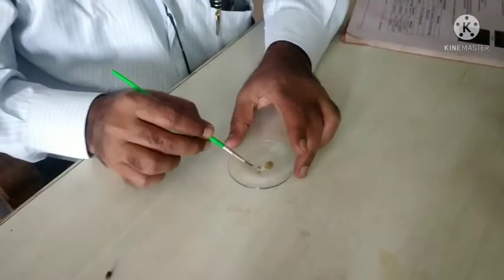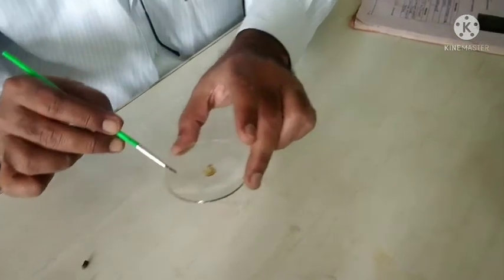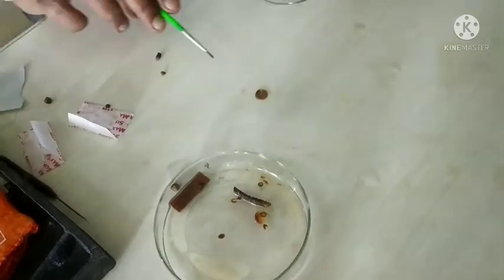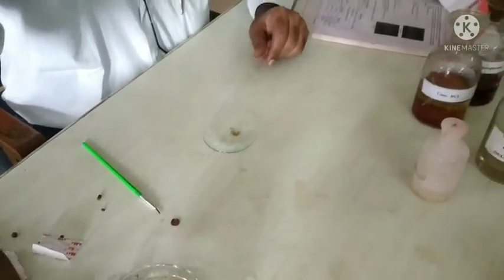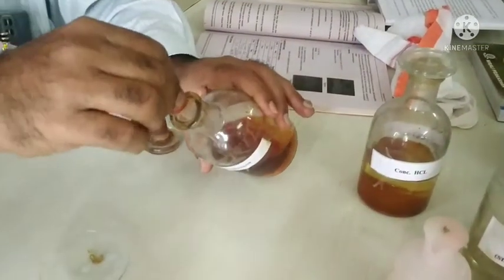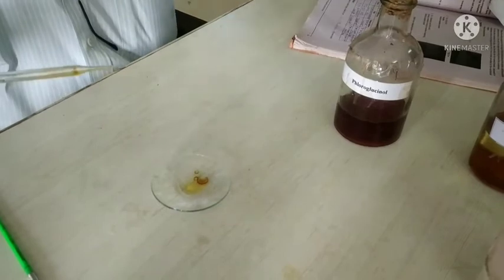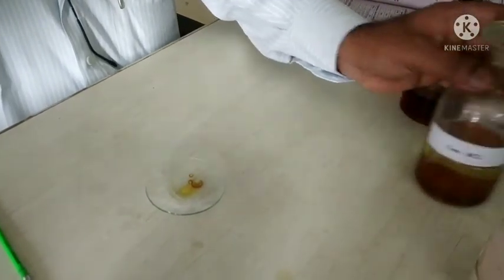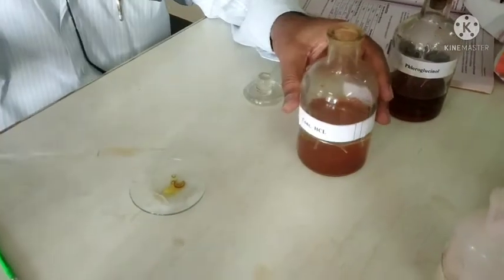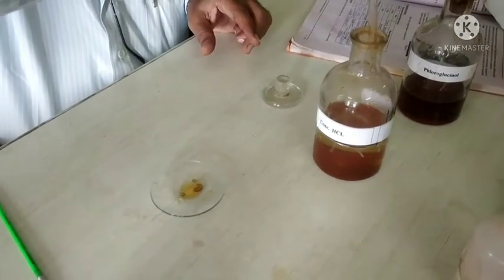After 5 minutes, remove the bleaching reagent from the watch glass. Then use a specific microchemical reagent for staining. We are using phloroglucinol and concentrated HCl in a 1:1 ratio. First, use 5 drops of phloroglucinol, then 5 drops of concentrated HCl — that is the 1:1 ratio. Place 5 drops of concentrated HCl on the section and treat the section for at least 5 minutes.